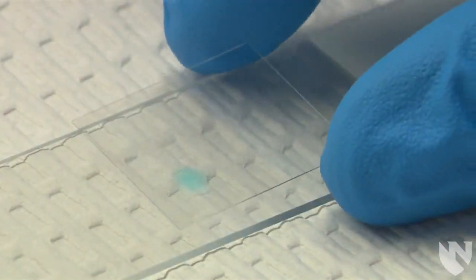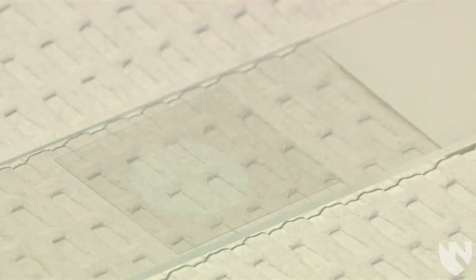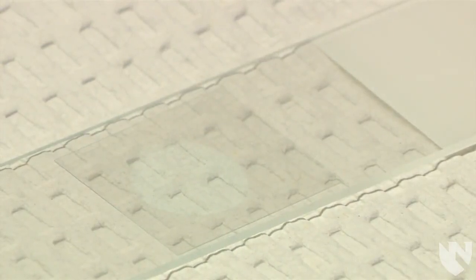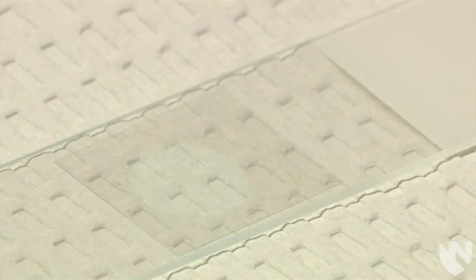If you dispense too little sample on the slide, the sample will not distribute properly and your fields of view will be skewed. So discard this slide into a sharps container and make a new slide.